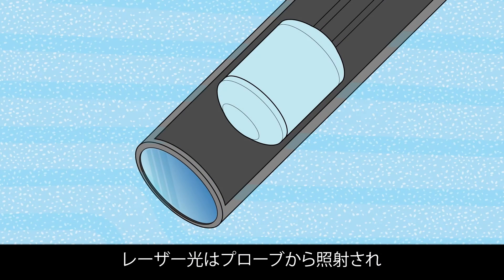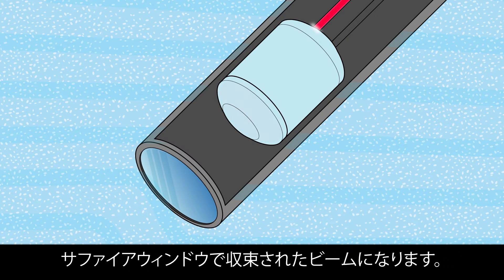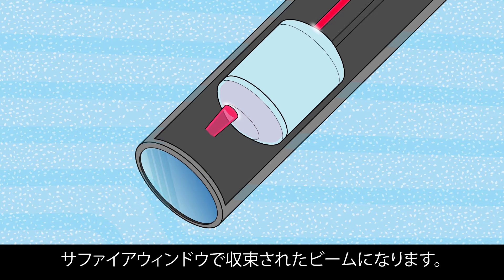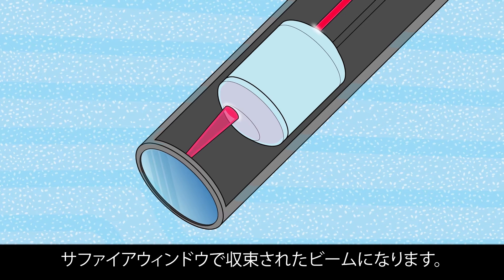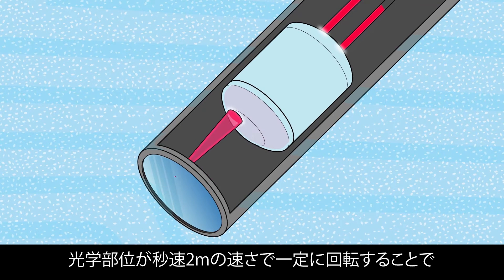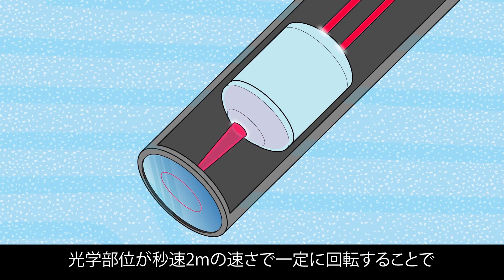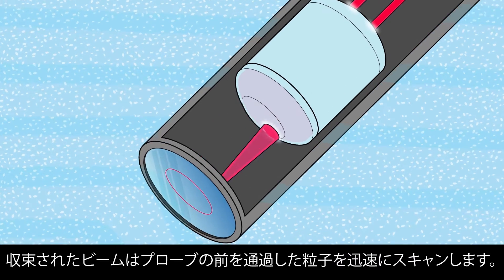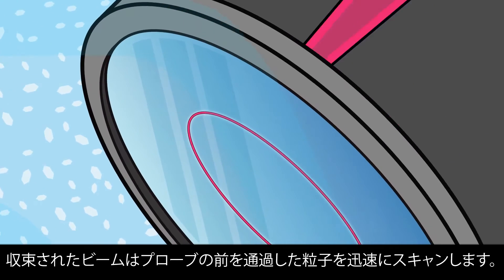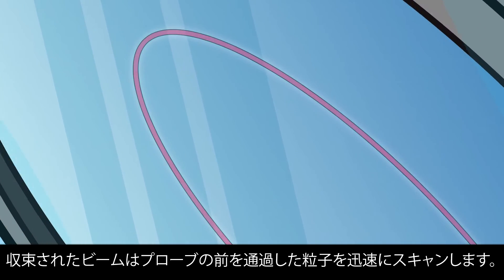A laser beam is launched down the probe tube through a set of optics and focused to a tight beam spot at the sapphire window. The optics rotate at a fixed speed, typically 2 meters per second, resulting in the beam spot rapidly scanning across particles as they flow past the window.